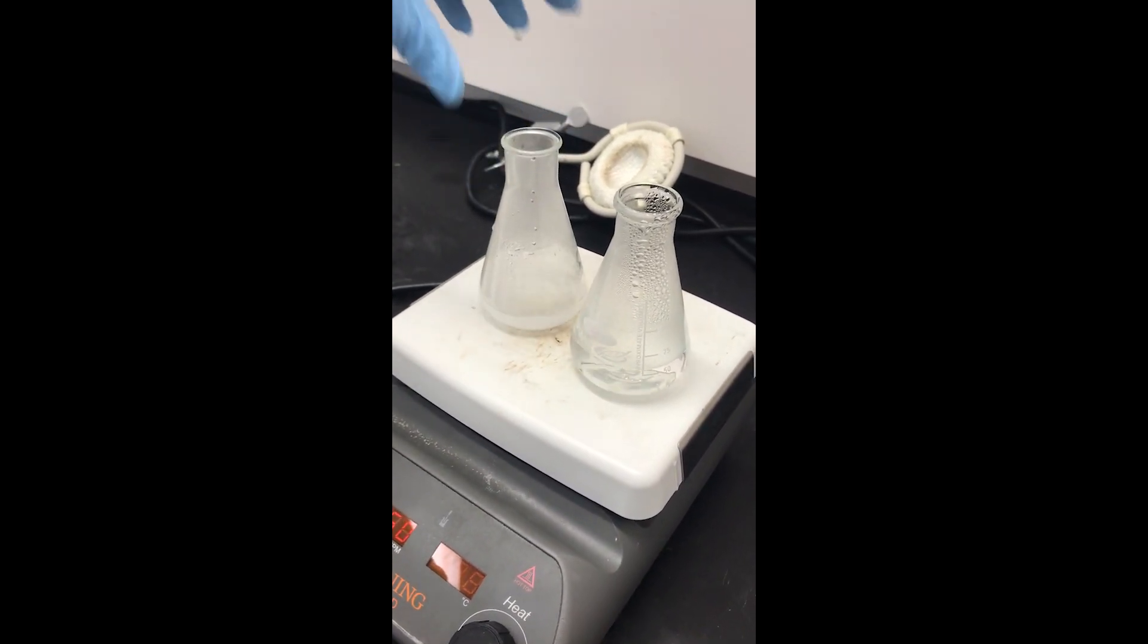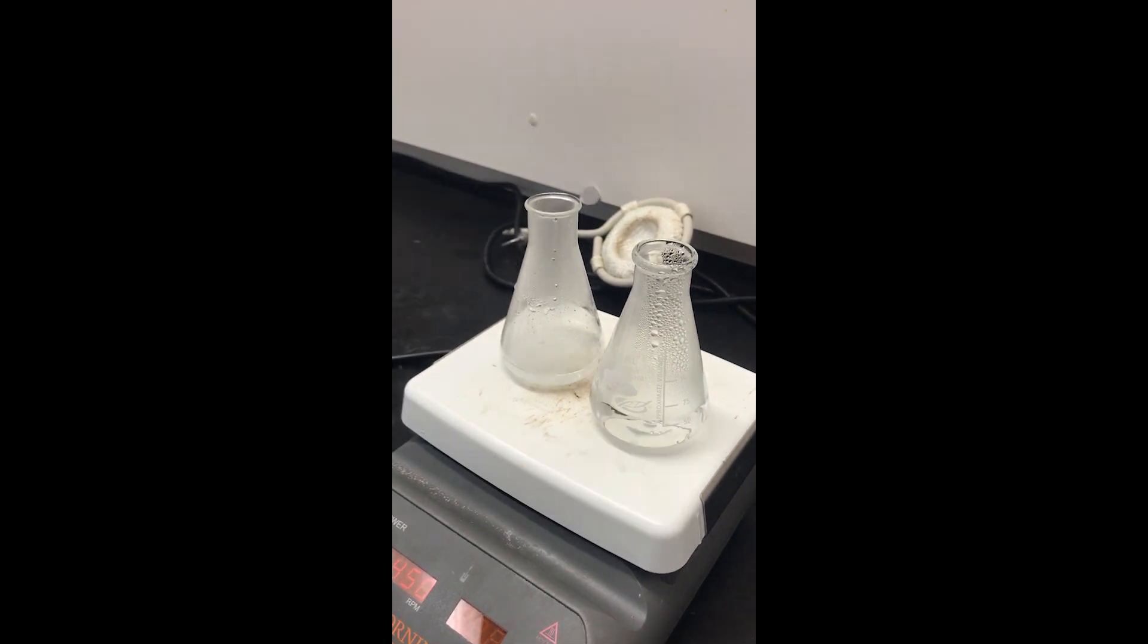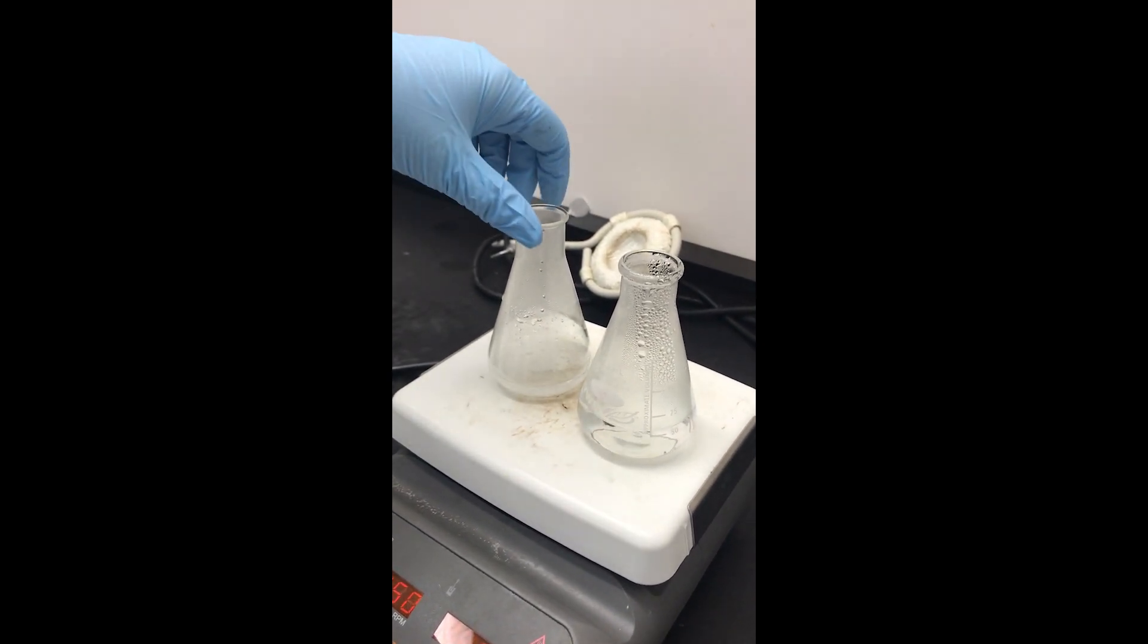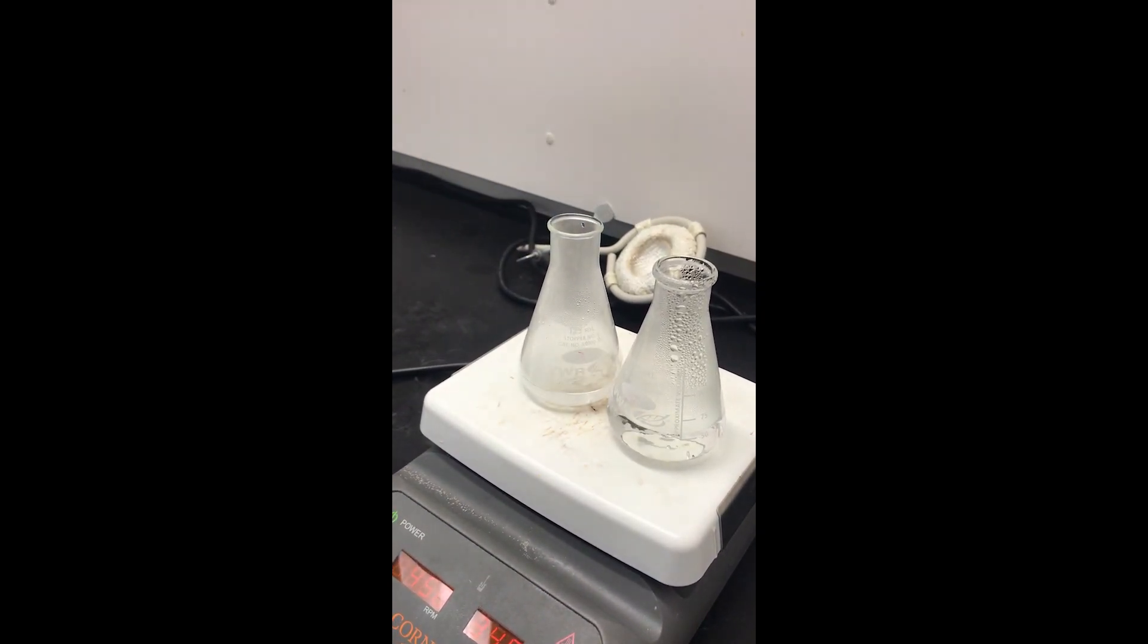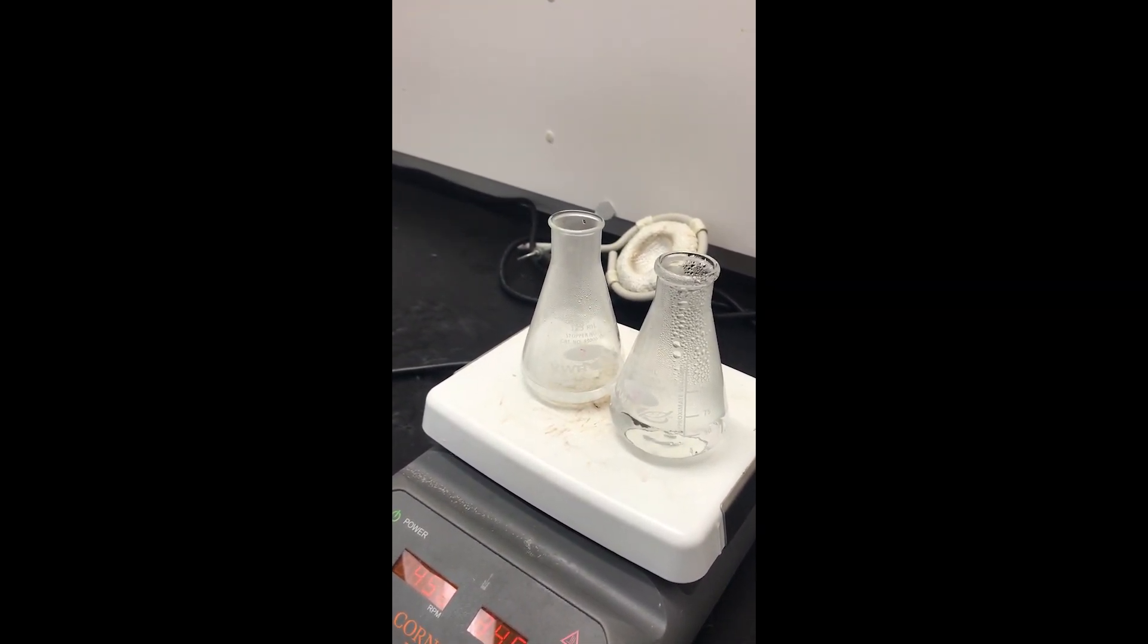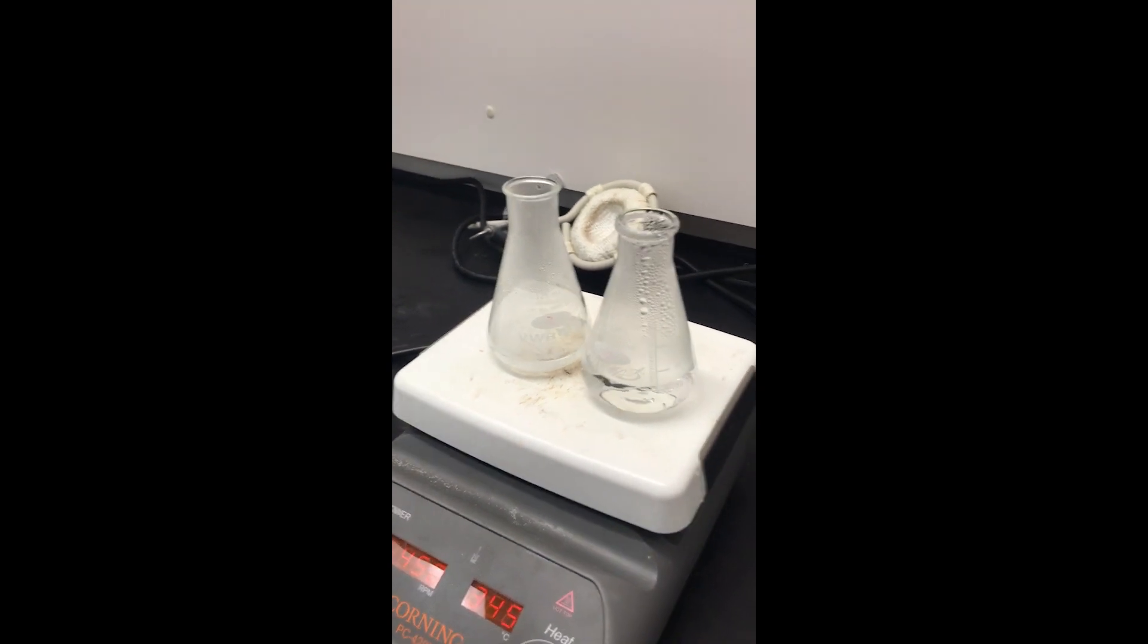Swirl, swirl, swirl, put it back on hot plate. Definitely appears that there's less solid in there and that's something you want to keep an eye on - you should be slowly dissolving the solid.